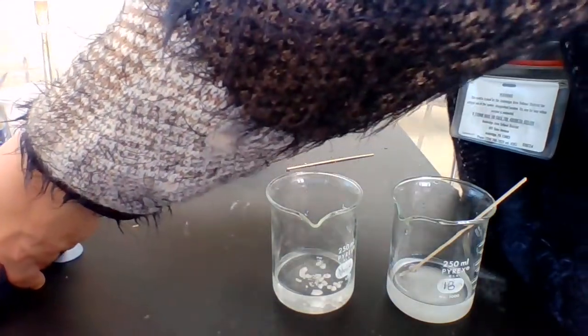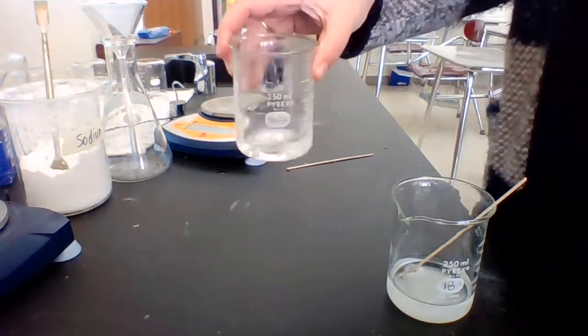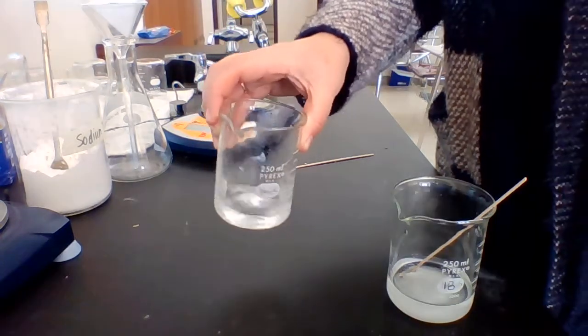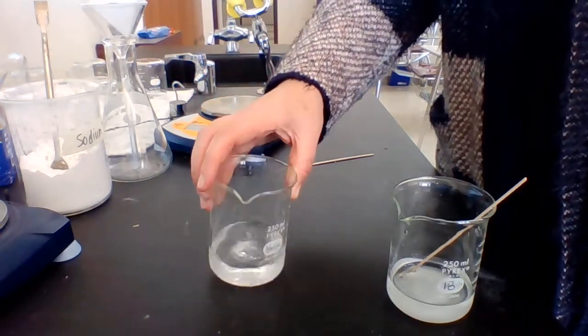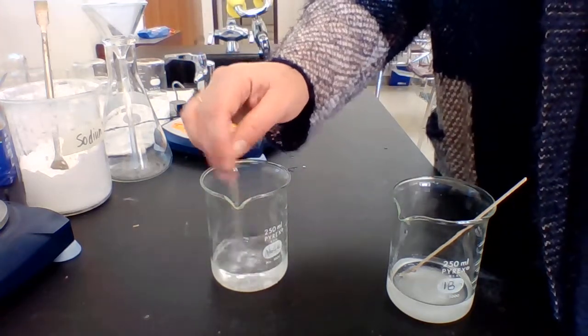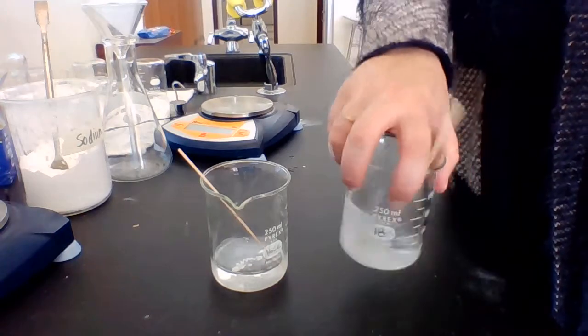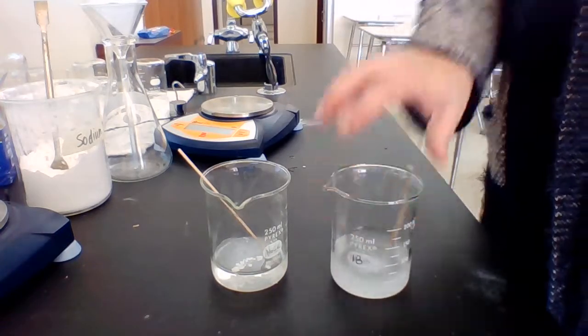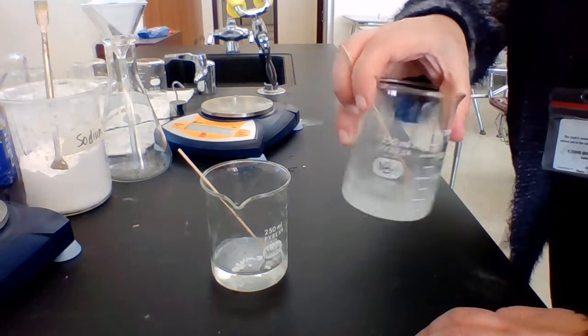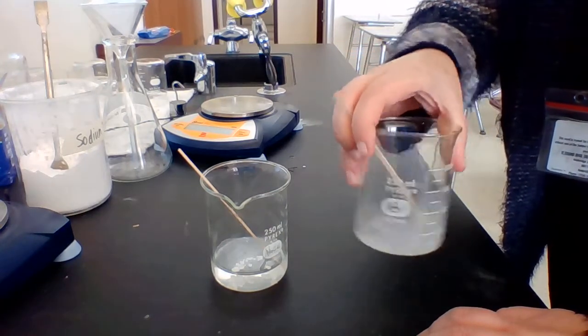Both of them are ionic, and when they dissolve, the water almost acts like a mechanism to allow the different ions to interact with one another. In their solid form, they're not really going to react too much. They won't react at all, really. So it's the water that's allowing that to happen. Now, as you can see, it's happening slowly. They are both going to dissolve into water.